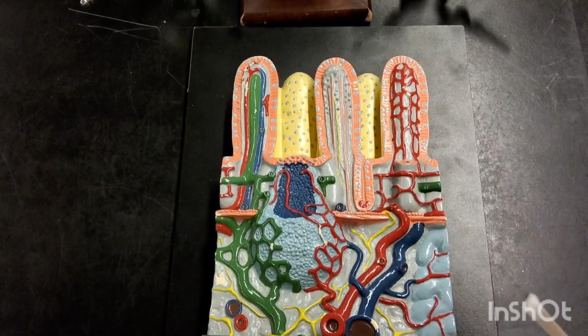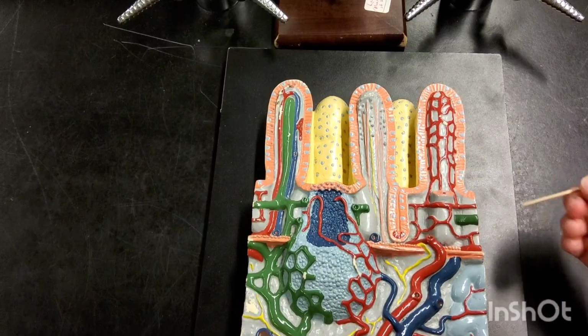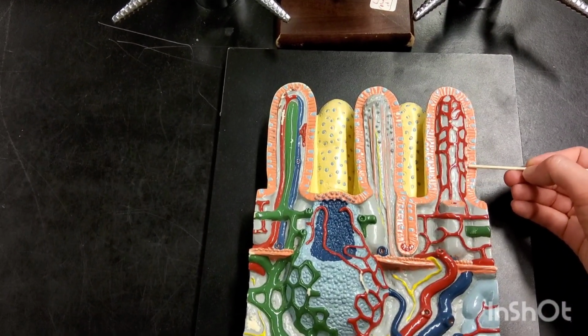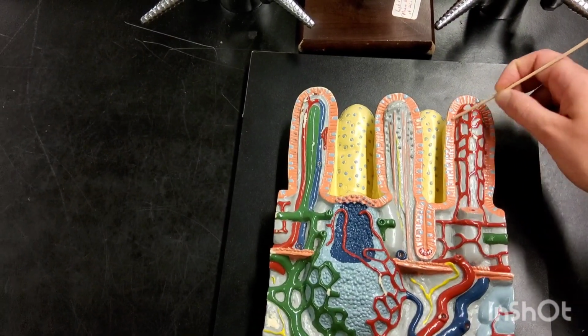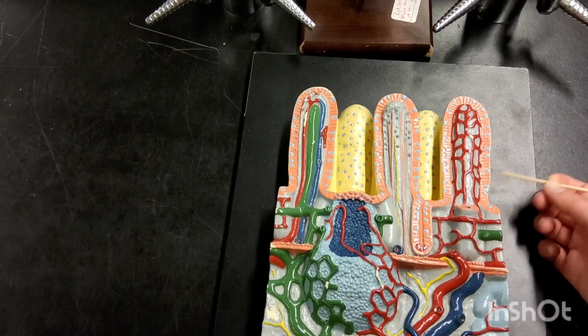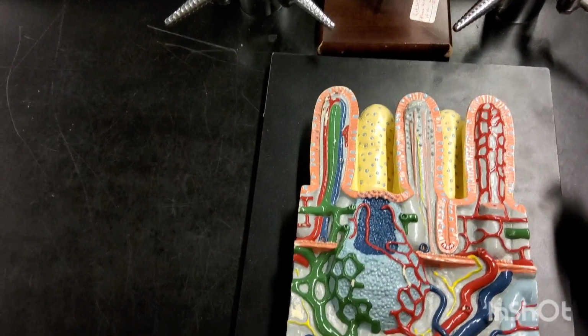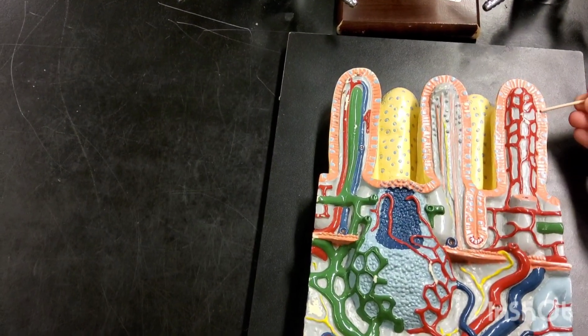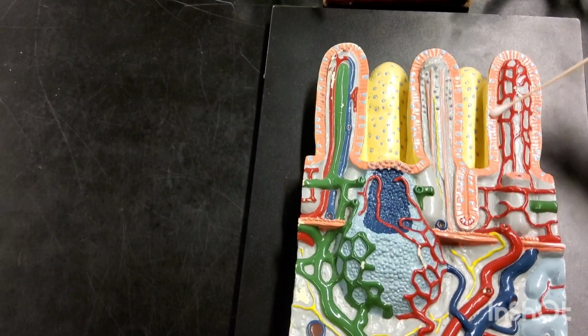Within that mucous membrane, we have these finger-like projections called villi, and this is again where we have mucus goblet cells, they're called, producing mucus that is released into that alimentary canal. So each of the blue-gray structures are individual goblet cells. Got one here, one here, one here, and they are interspersed with this columnar epithelium.